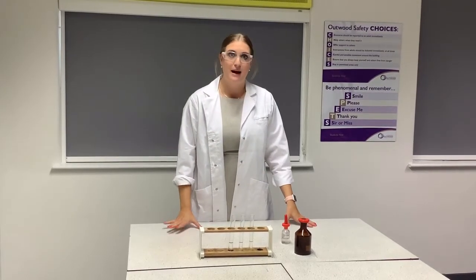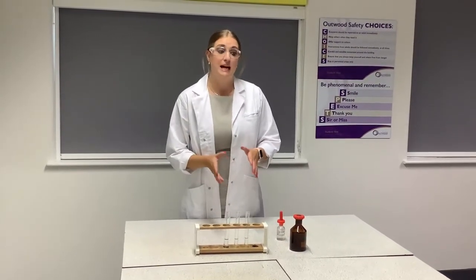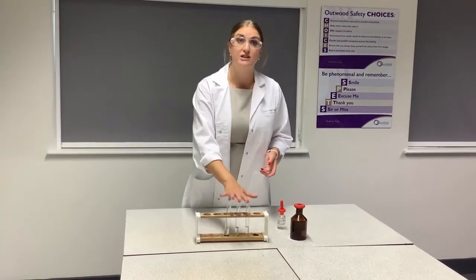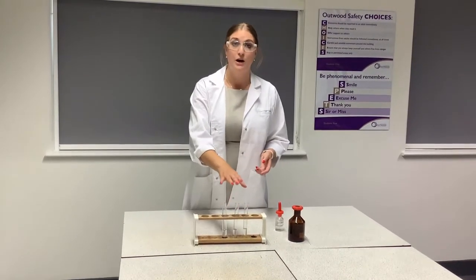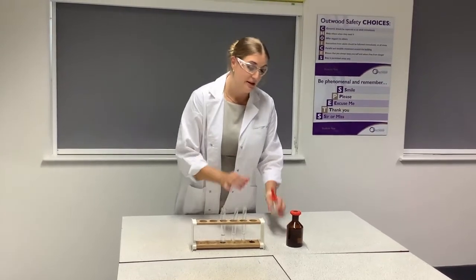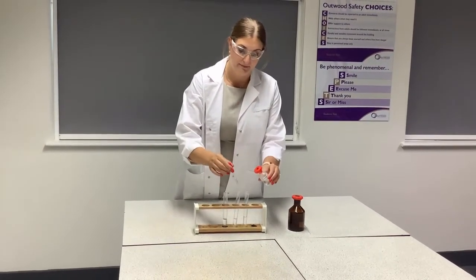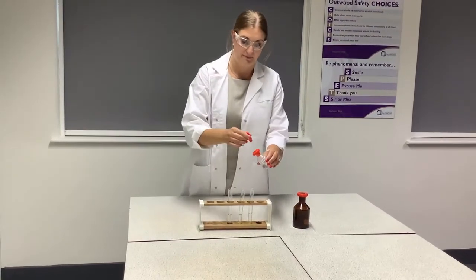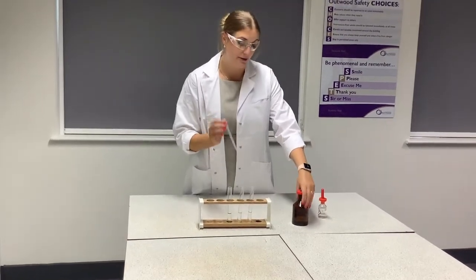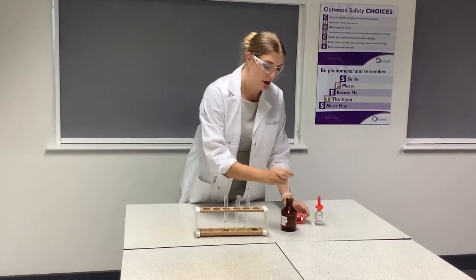In this video I'm going to do some tests for halide ions. We add the same reactants but get a different colour precipitate depending on which ion is present. I have solutions of chloride, bromide, and iodide ions. The first thing I'm going to do is add some nitric acid to each one, then add a small amount of silver nitrate solution, and we will see a precipitate form. I'll add that to chloride first.